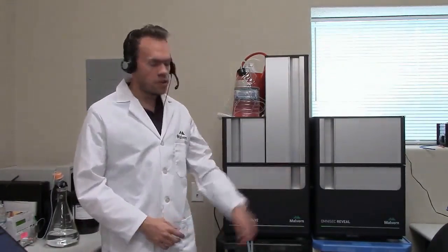So now we've flushed the whole system out with water. We've let it run for a good hour at a mil per minute, so 50-60 mils have gone through the system. And we've purged out all of the purge lines, the RI and the viscometer purge lines, to make sure that they are all clear of salt and there should be no salt left back in the system. Flushing out salt is the number 1 step. We have to get rid of any salts that could precipitate when we exchange the mobile phases.